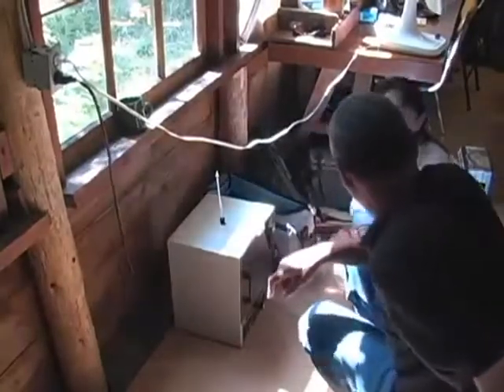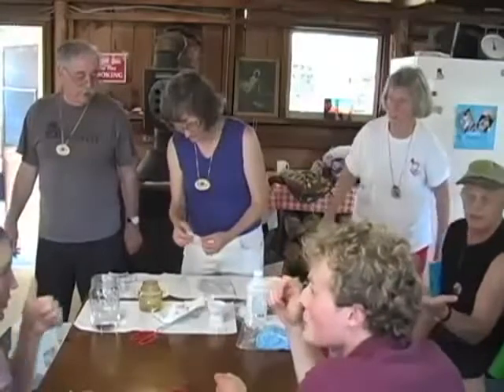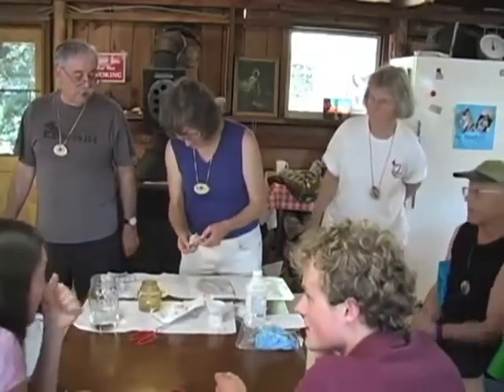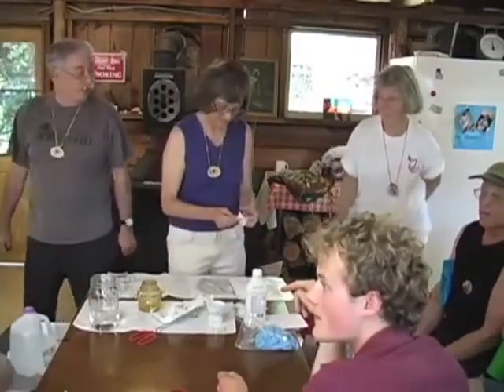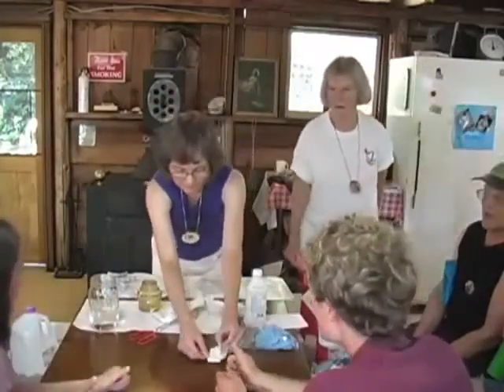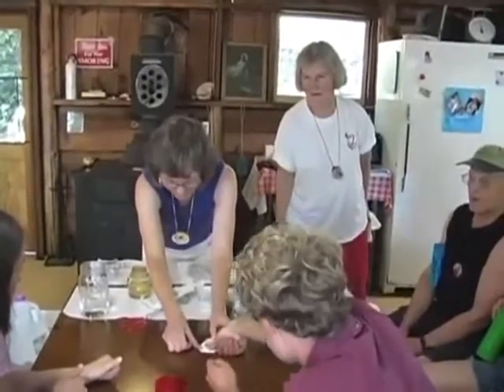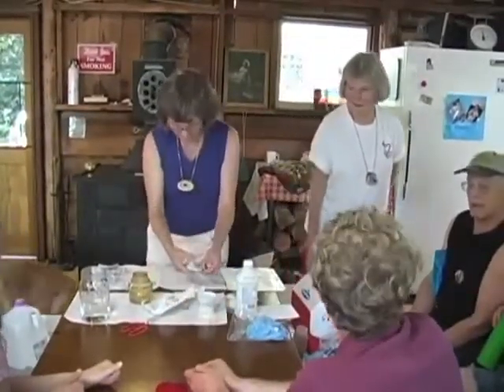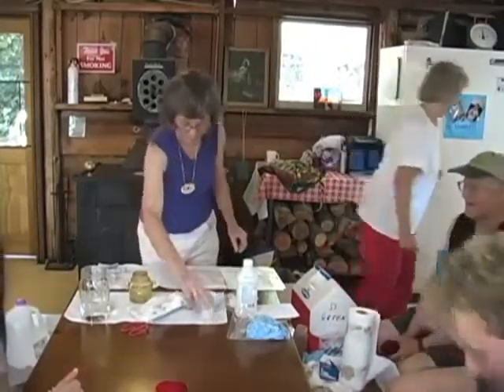But I've got a clean thumb, I don't know. Touch the table. I just threw my stuff away, but I'll just open it and expose it. Scratch your head with it. And then put it on. We're going to have William's thumb. It doesn't take much to see. There you go. There he goes. We'll get the feedback from the FBI. That's the one. He got stuck.